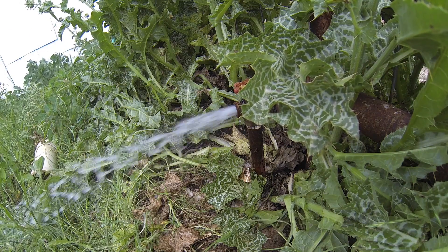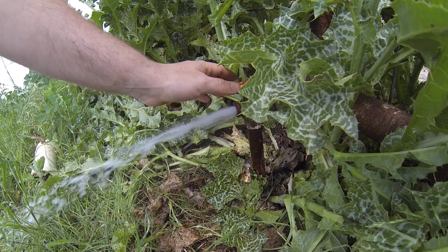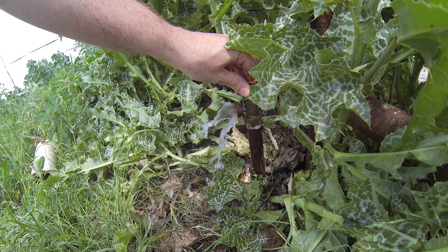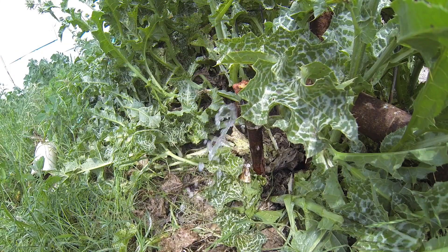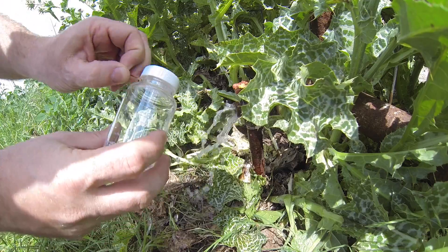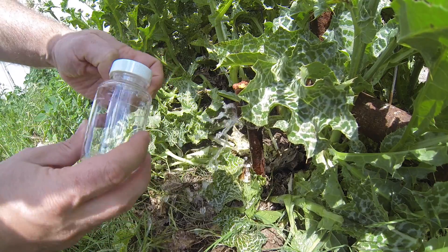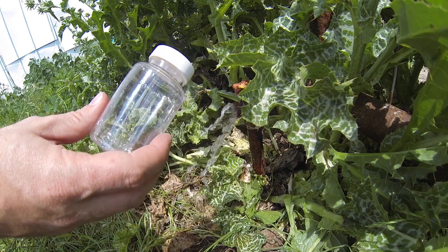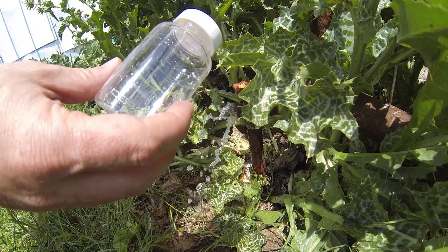We've got a little bit of a puddle going here now, so I get to stand in the water puddle. I'm going to turn this down to a slow, steady flow. And I'm going to break the seal. It says very specifically not to put this on the ground ever. So it has not been on the ground — it came out of a paper bag in the truck.